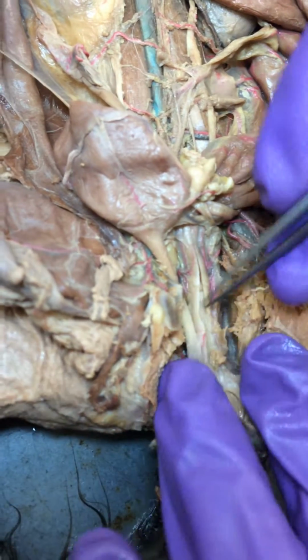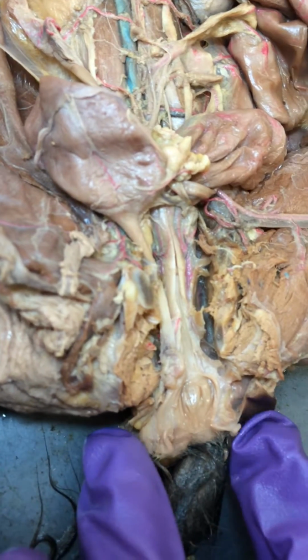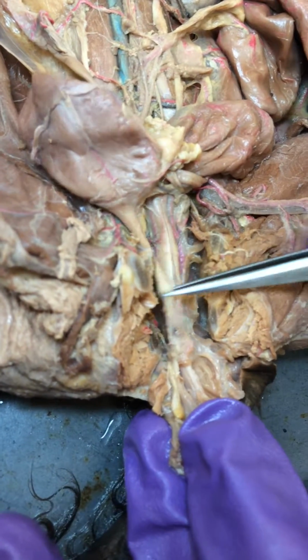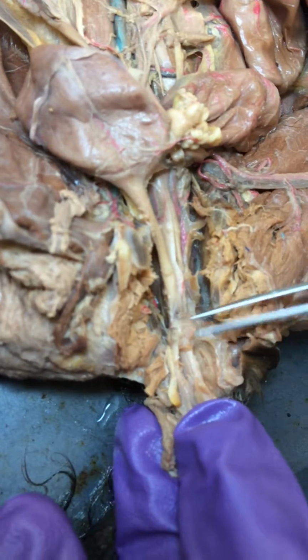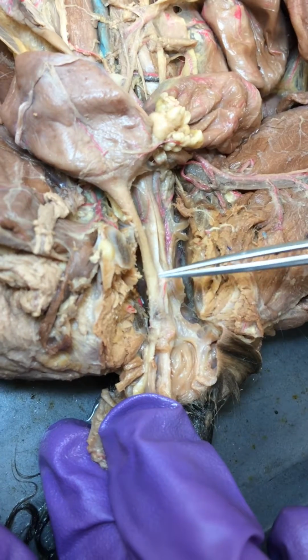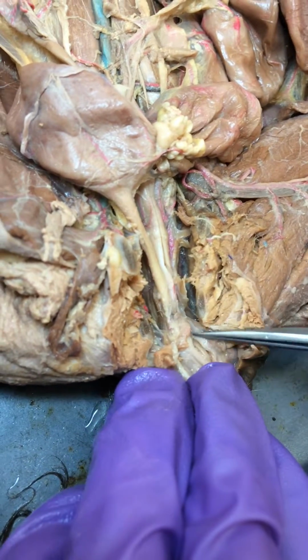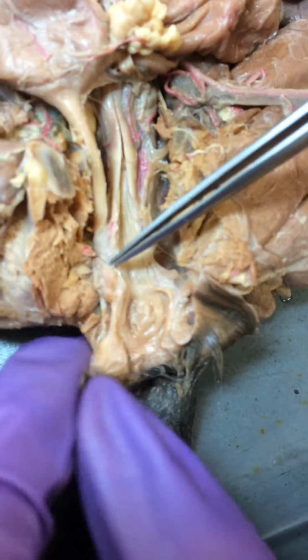So now if we go down the vagina, right here is our urethra. It goes into the bladder. And so the vaginal vestibule is the area where the urethra and the vagina unite. So we cut ours kind of over to the side, so whenever we flip this open, we're going to be looking at the ventral surface of the vagina.